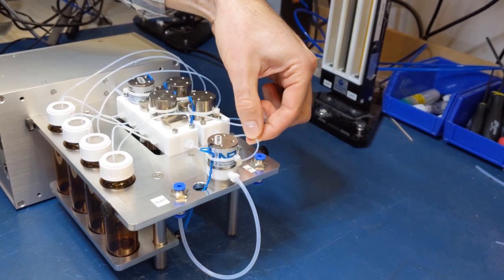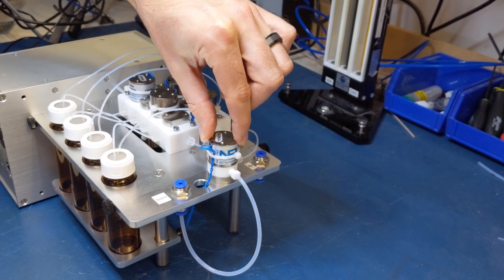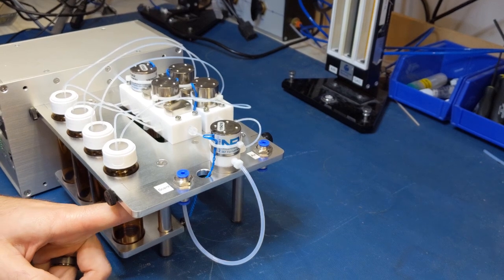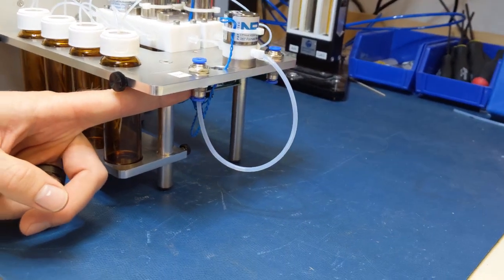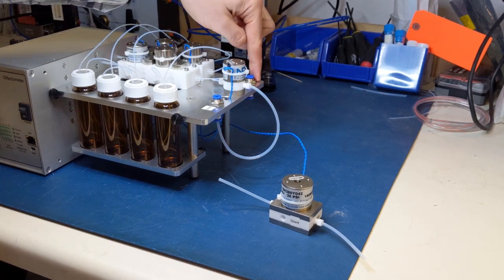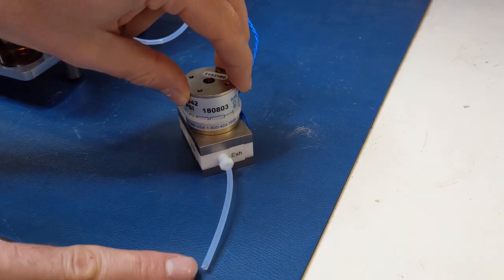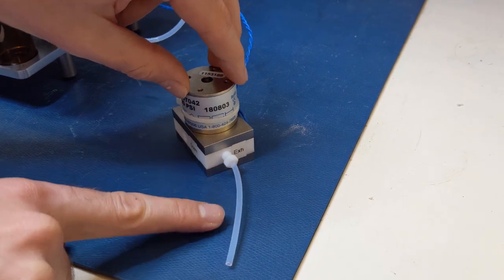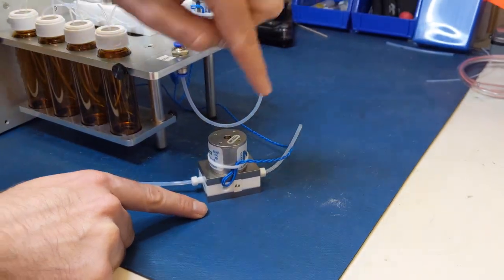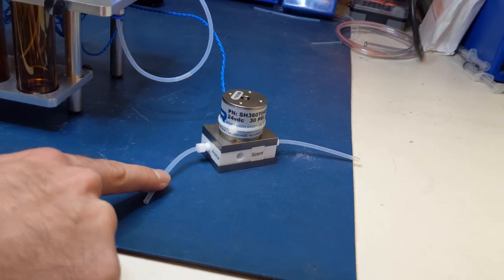The dilution and odor streams mix together as they flow to the mixing valve, where they create the desired concentration percentage following the odor stabilization delay. Once the stabilization delay is reached, the mixing valve opens and odor flows to the scent port of the manifold. The scent port and air port both flow to the final valve where they terminate using inert fittings. This fast switching solenoid valve consists of two outputs: the first is the exhaust, which is where the odorant would flow until delivered to the animal. The second is animal, whereby the clean air connection would enter the final valve and constantly be delivered to the animal until odorant is delivered. The flow rates between these two outputs would be matched, mitigating pressure changes during odor delivery.